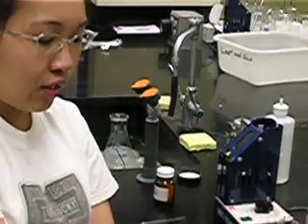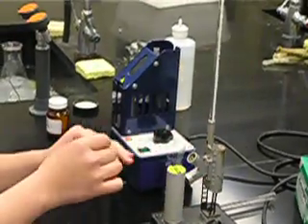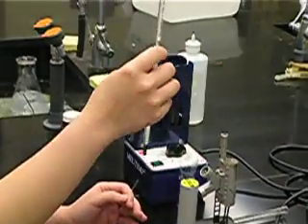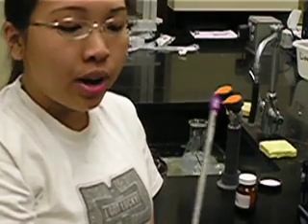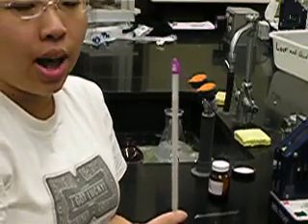And once you're done, you just have to turn the machine off, remove the capillary tube. And what you want to make sure is that you remove your thermometer and place it back into a holder in the hood. You don't want to put it horizontally on the counter because that will break the thermometer and we don't want that to happen. So just put it back in your hood and we're done.